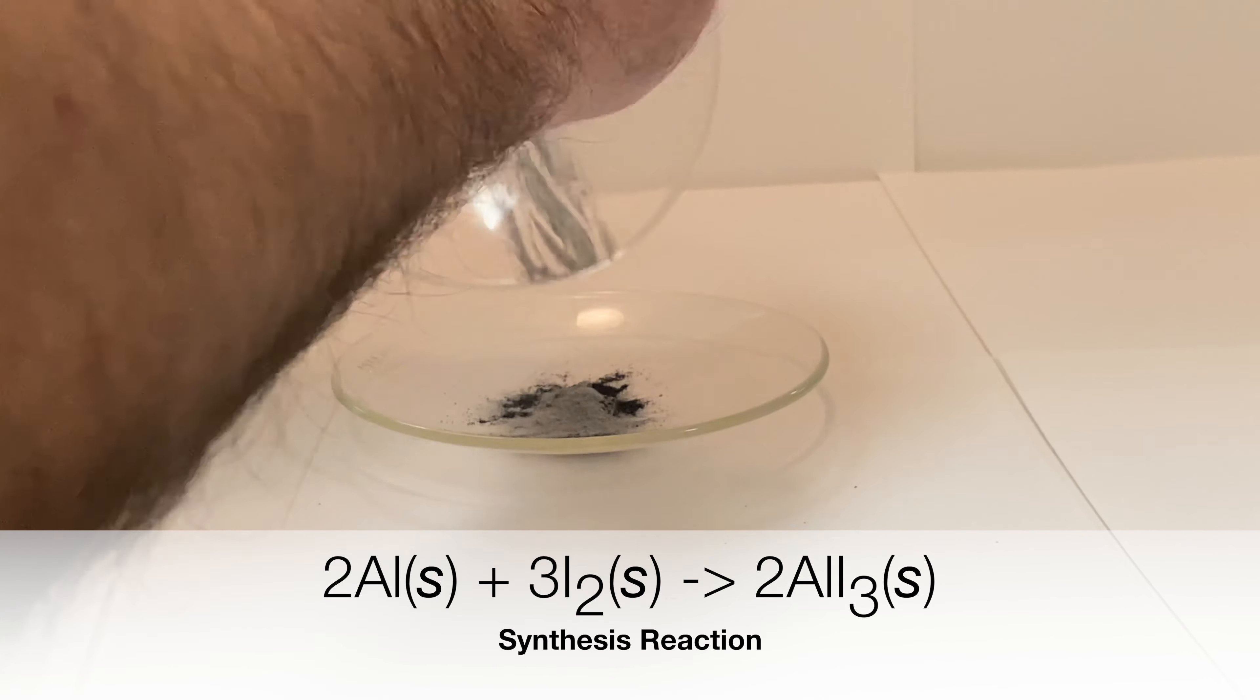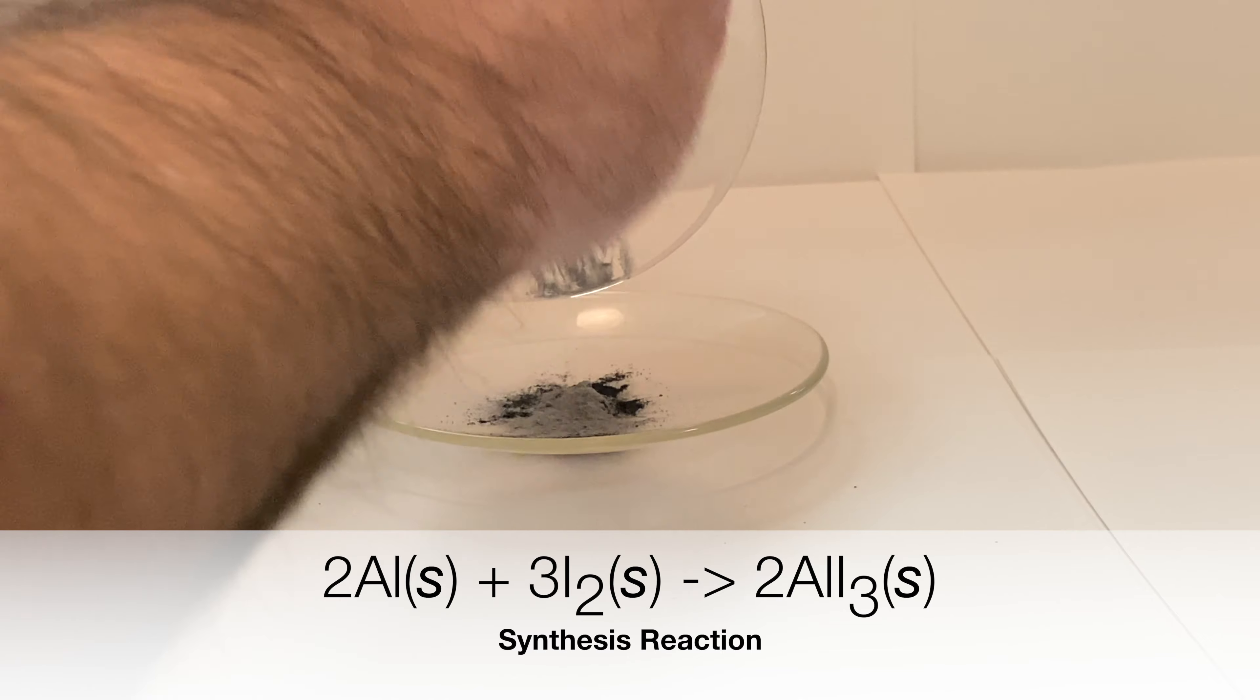In our first demonstration, we're going to demonstrate the first class of chemical reaction, which is known as a synthesis reaction.